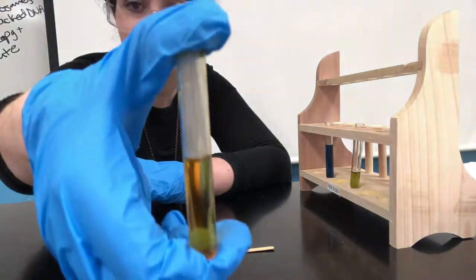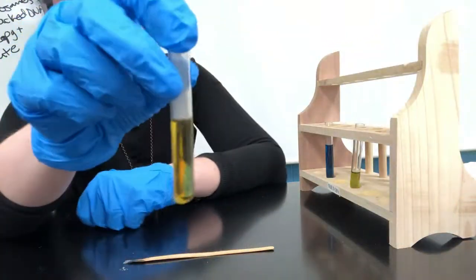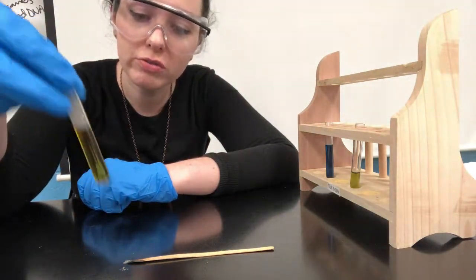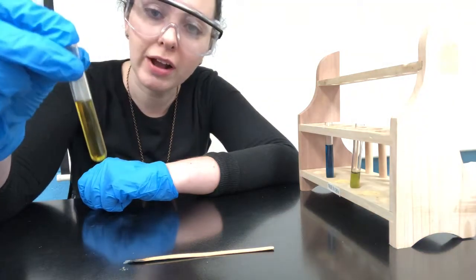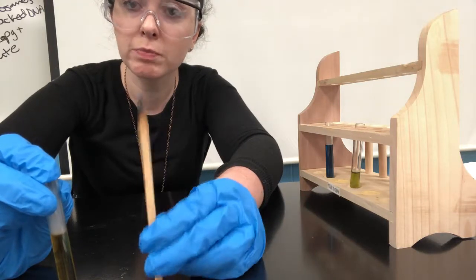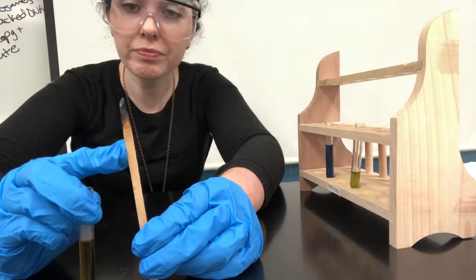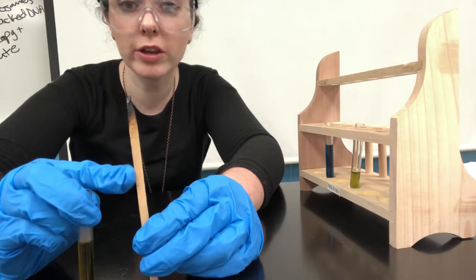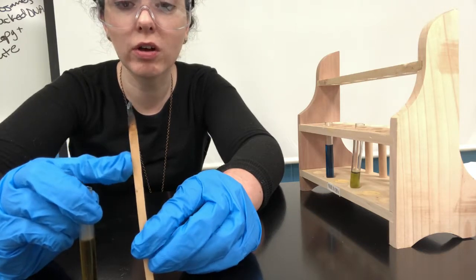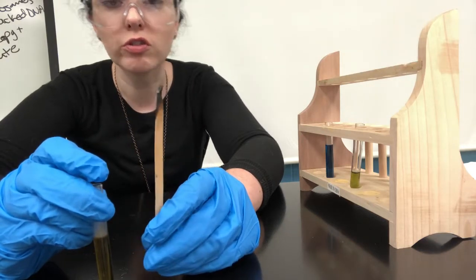Aha, look at that. All right, so what happened? It turned bright yellow, even more yellow than when I exhaled into the tube. So as you can tell, combustion is a reaction where carbon dioxide is released. It's where a hydrocarbon is burned. So in this case, it's wood. Other ones can be coal, other types of fossil fuels, and also the candle that you're using to represent the burning of fossil fuels is a wax, and that can also be burned. And in the reaction, it's going to release carbon dioxide.